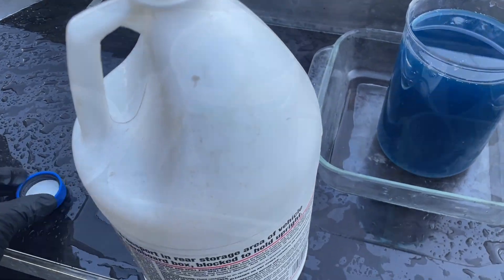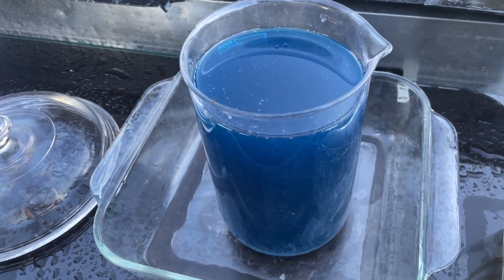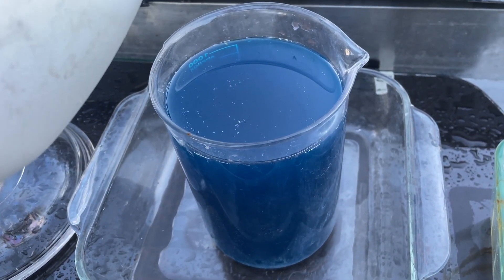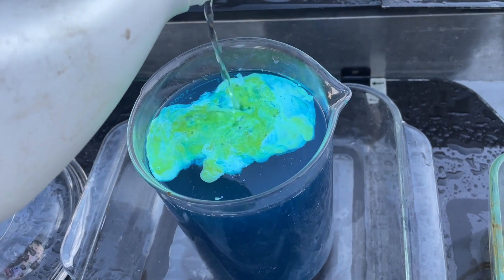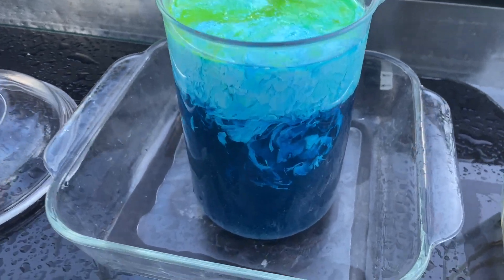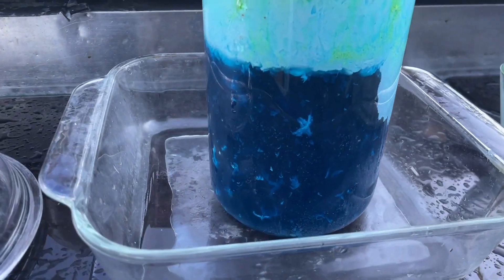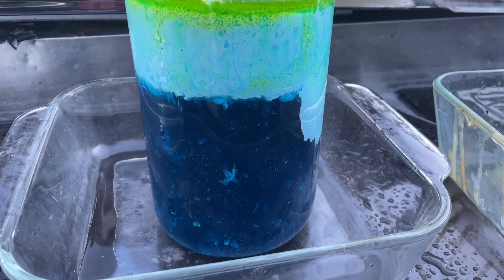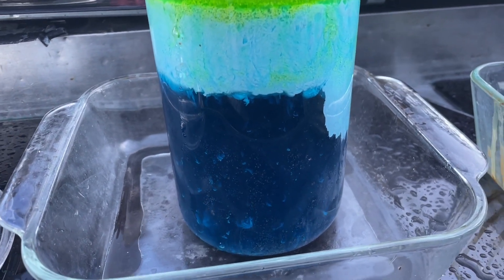Now I'm going to convert all the silver chlorides. I'm gonna add a little bit of hydrochloric acid to the silver nitrate — watch it'll immediately convert it, going real super slow. If I stir that up, of course it'll go crazy and then the chlorides will start falling out of that solution.